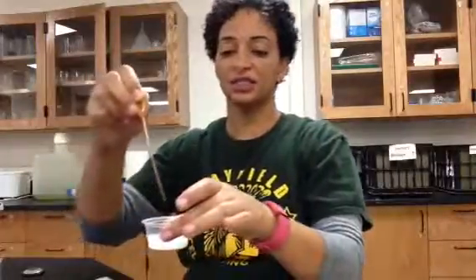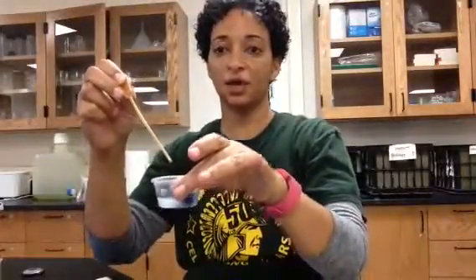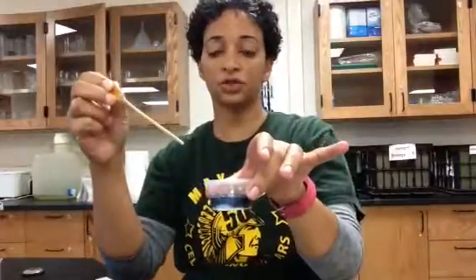Some of the supplies we're going to be using today: a little bottle of iodine solution. Iodine solution is an indicator that turns different colors in the presence of starch. As you can see, when I suck up some of this iodine — iodine is a nice brown liquid — but when I add it into a container that contains starch, the mixture quickly turns black. So iodine is an indicator that turns black in the presence of starch.